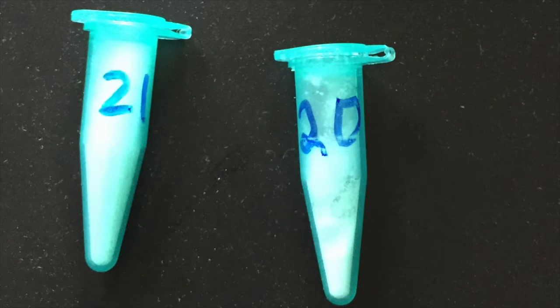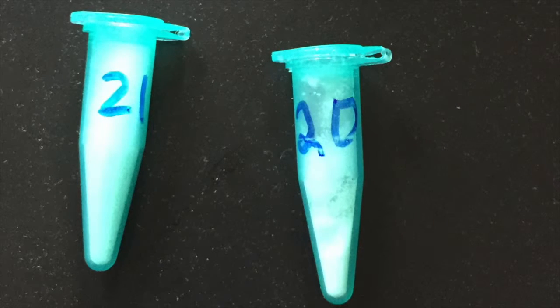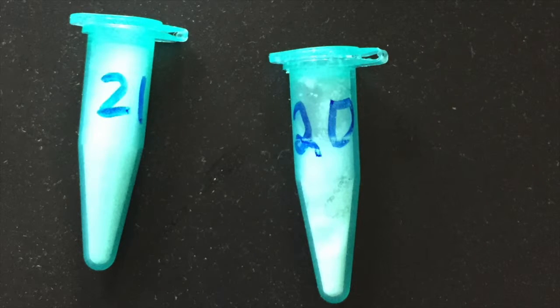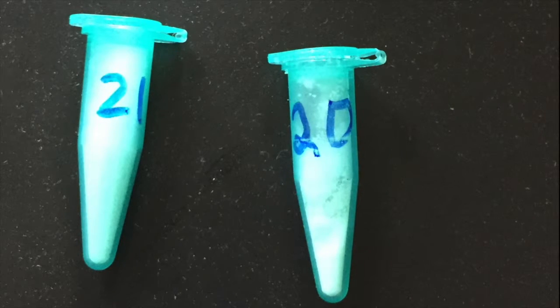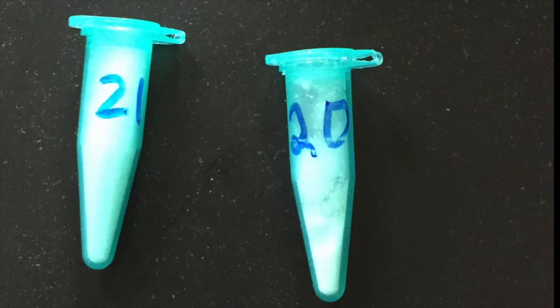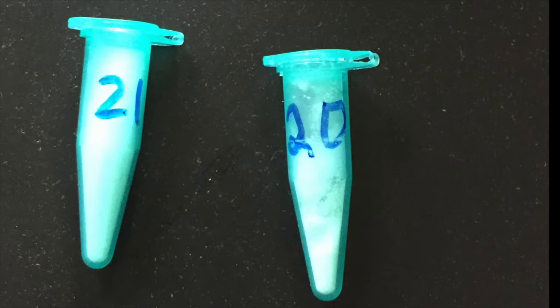Our first test was the color or visual inspection test. From the color test, we essentially just looked at the elements and were able to deduce that substance 21 had a very sugary makeup of an abundance of small particles that were situated right next to each other and were very compact in nature.